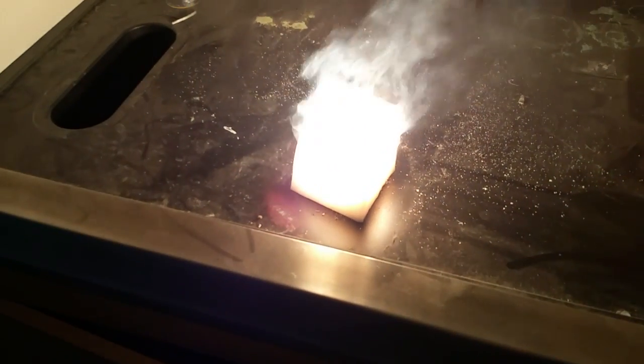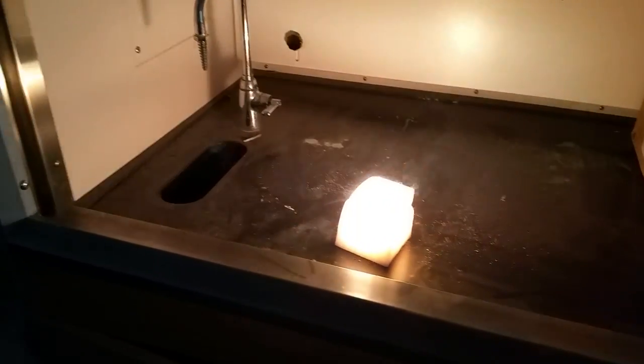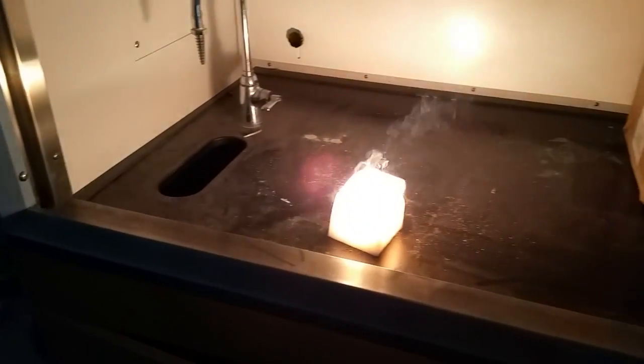But I'm telling you about applications of the magnesium. So what's happening is, if I were to put a candle next to that dry ice, the flame would go out. Because the dry ice is CO2. Whoa, whoa, whoa. Beautiful, right?